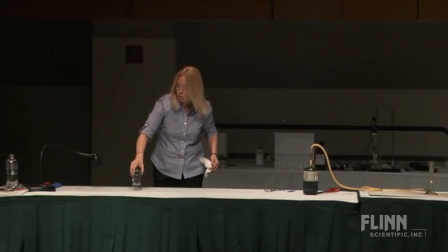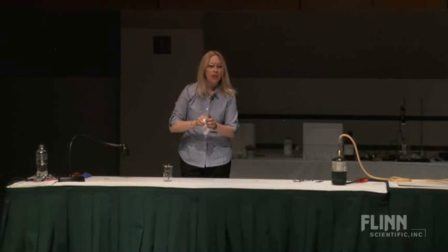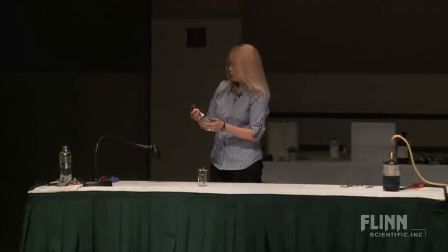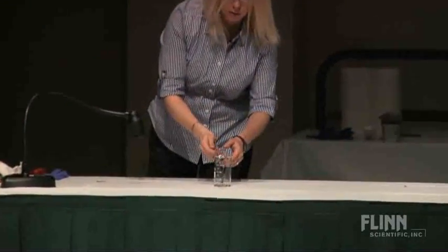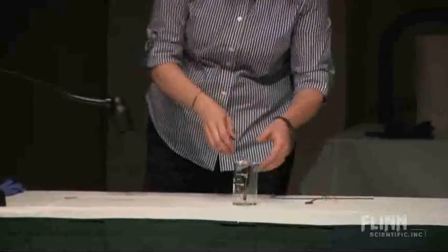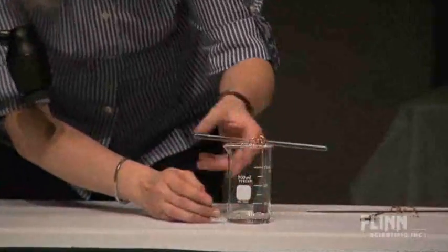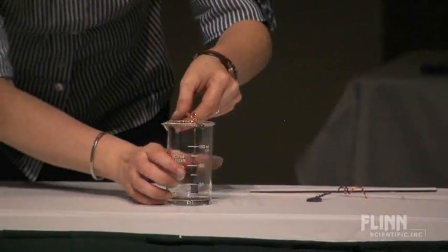And this is an old, old demo. In fact, the little picture in your handout is from a 1940-something era write-up in J. Chem Ed, which I thought was kind of cool, and I'll show you what I've got here. If I can zoom in careful with this guy, maybe like that.